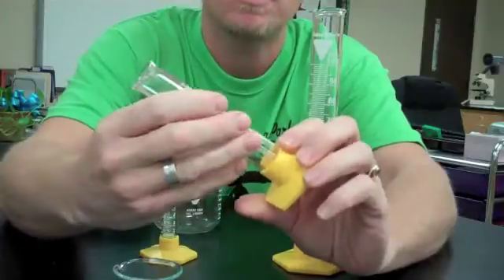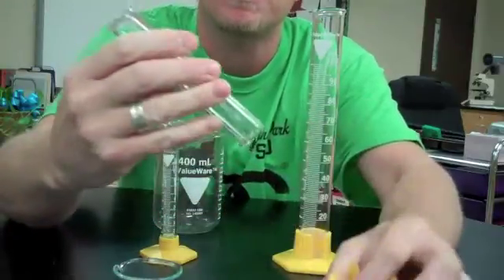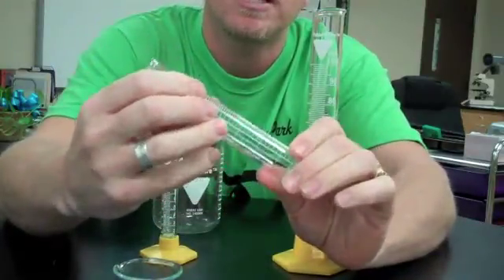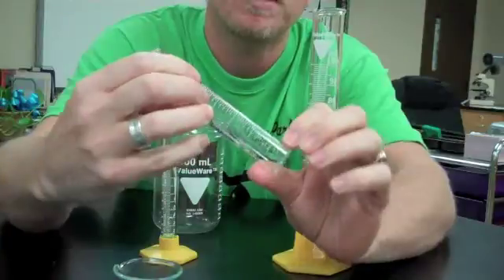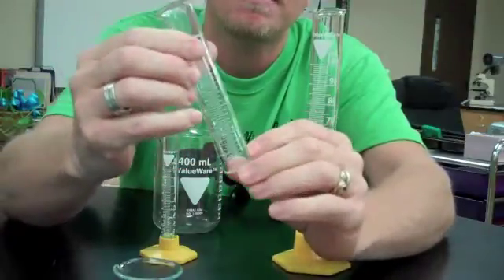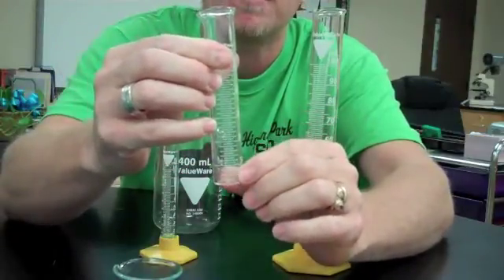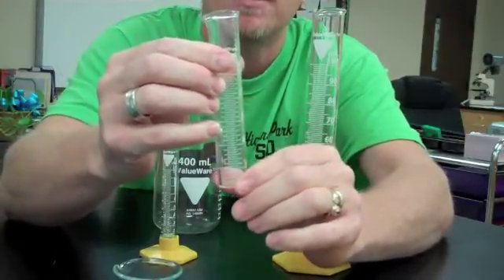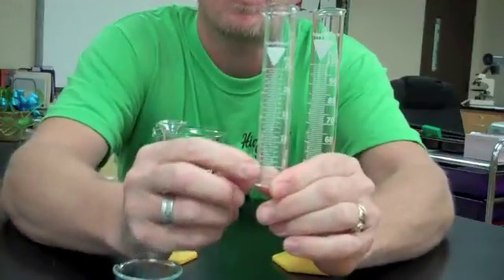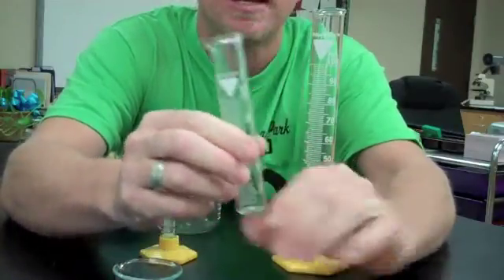If I want to be more precise with my measurement, I need to use something that has more lines that gives me a more accurate reading. This graduated cylinder actually will measure up to 25, and if you notice, it has lines before 5 ever comes into play. So we actually have a more precise measurement because we have more lines.